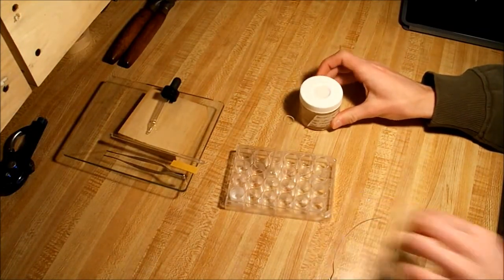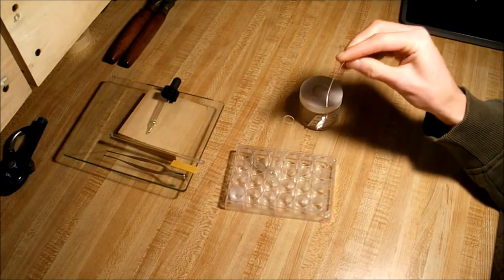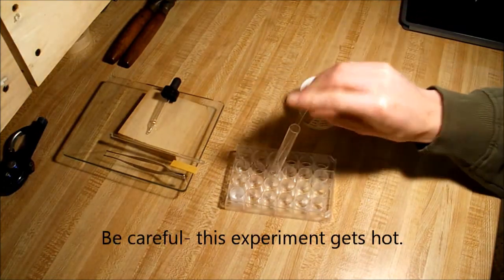And then you take your aluminum wire, like I have it balled up on the end, and you place it into the acid.